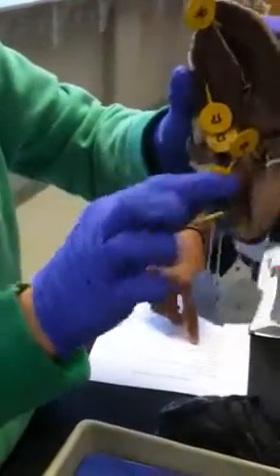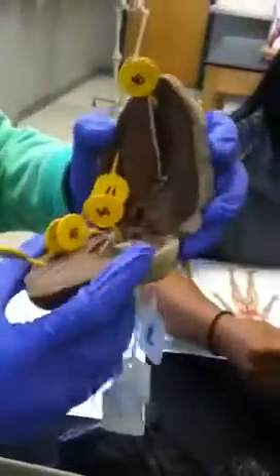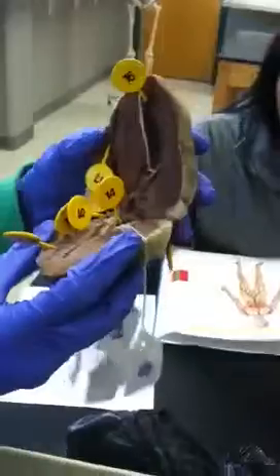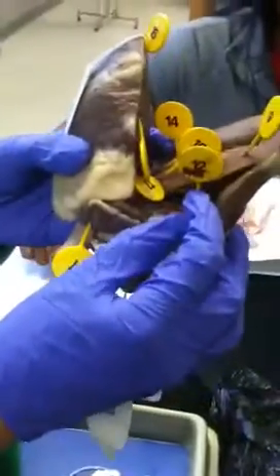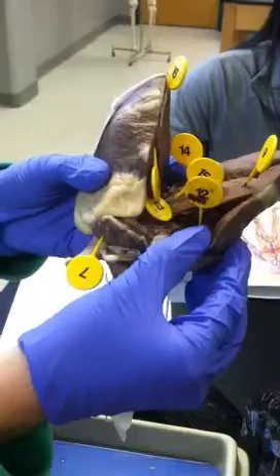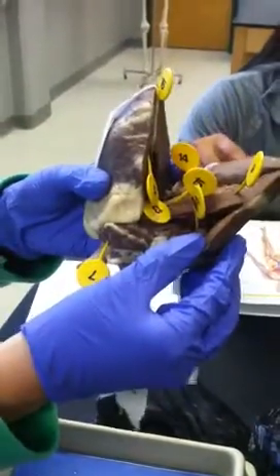Okay, and number 11 is the chordae tendineae. It's just these little strings attached to the atrioventricular valves, and they're like white collagen cords that anchor the cusps. And then you have the tricuspid valve, number 12. It's on the right side, the right atrium, and it's the tricuspid valve because it has three flaps that are connected with the chordae tendineae.